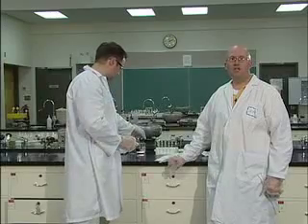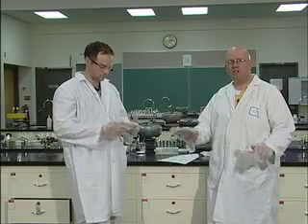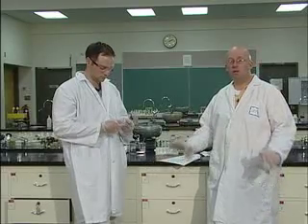Scott wouldn't let us do the combustion reaction, but you see that one every day in your car engine and in your own body. We have some combustion in there. Lots of observations in this lab. Do things slowly, methodically. Make sure you're comfortable. You know your tables. Make sure you're making lots and lots of observations. Any final parting shots? No.